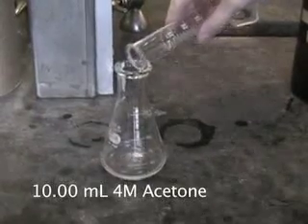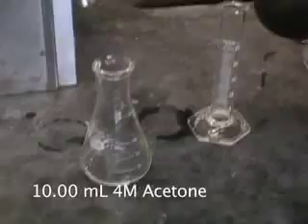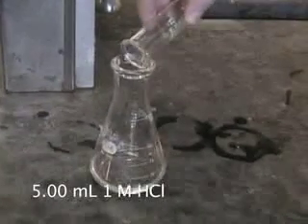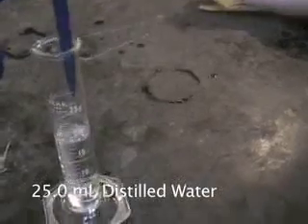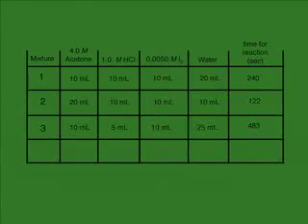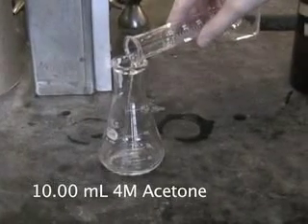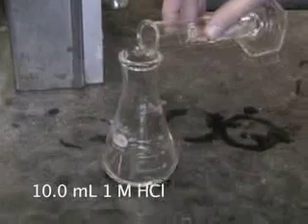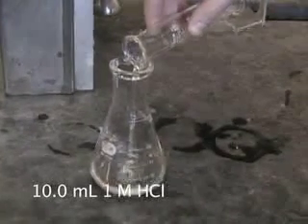In a third trial, we change the amount of hydrochloric acid. We go back to our original conditions of 10 milliliters of acetone and 10 milliliters of iodine. We only use 5 milliliters of hydrochloric acid and put water in so that the total volume is maintained at 50 milliliters. In a fourth trial, we change the concentration of iodine to determine the order of reaction of iodine.